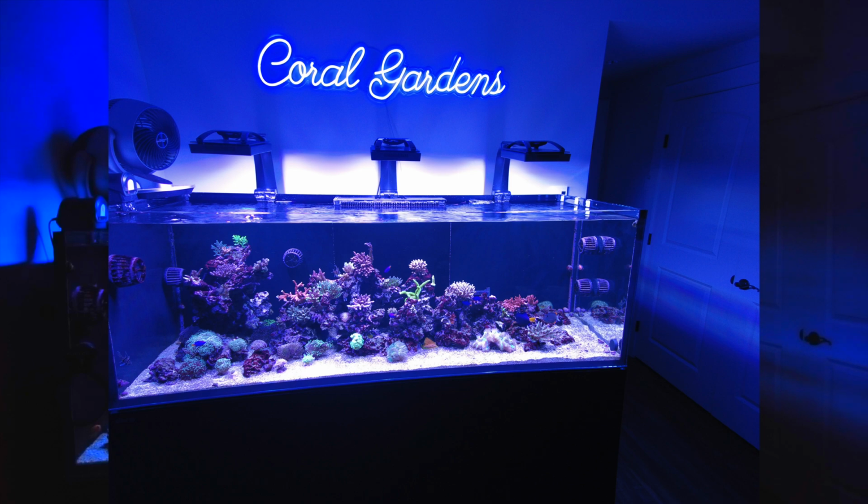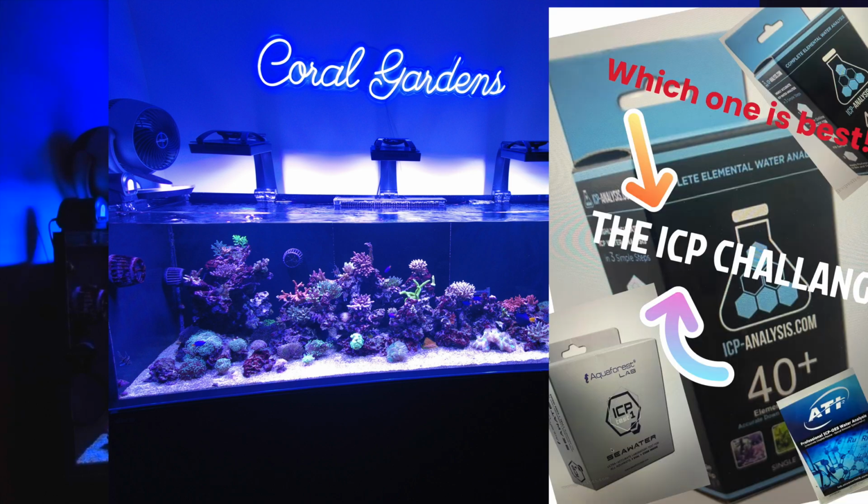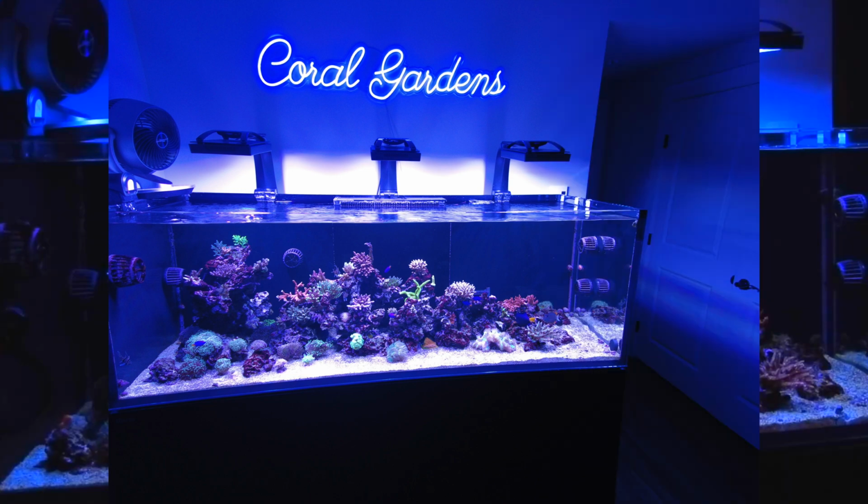Today I'm going to do a quick video about ICP tests. We're going to take the top 3 brand names, run a test at the same time from the same tank, and see what we get. Stay tuned.